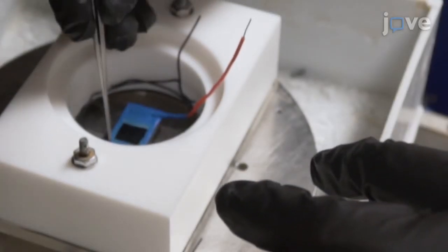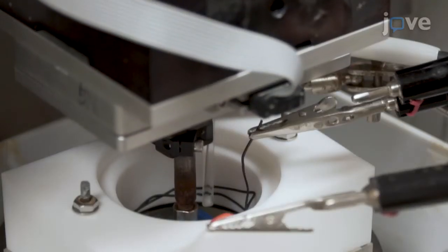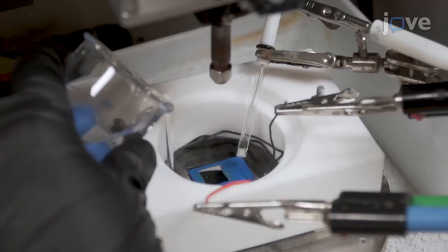A visual demonstration of this method is critical, as the accurate execution of multiple steps of the procedure are critical for achieving reliable and repeatable tribo-corrosion test results and are difficult to master by text alone.